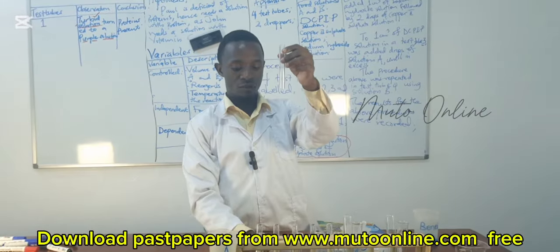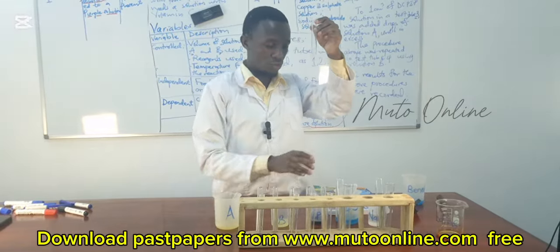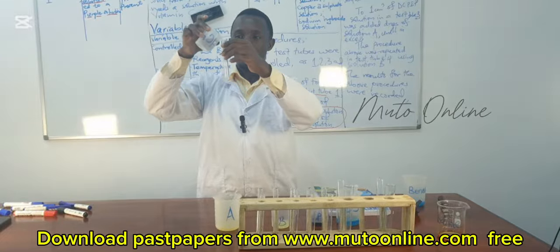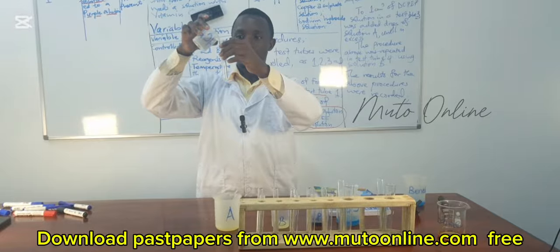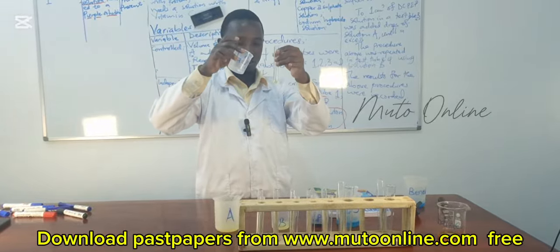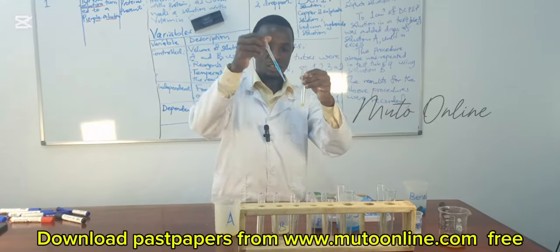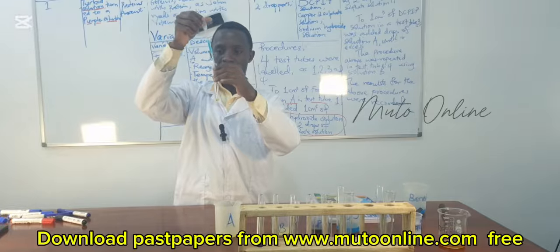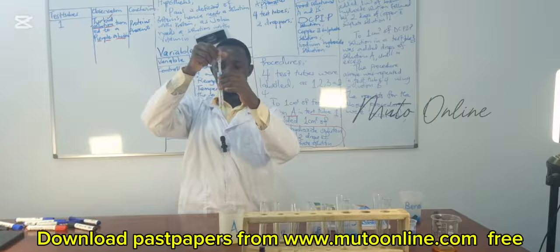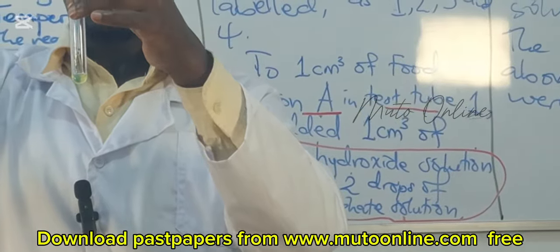So we have added 1 cubic centimeter of solution B, and then we are adding 1 cubic centimeter, an equal volume, of sodium hydroxide, and then we are going to follow that with 2 drops of copper sulfate, in test tube 1 and test tube 2.